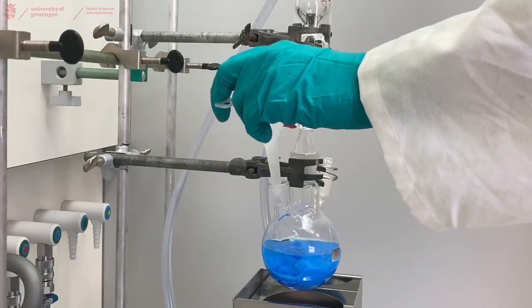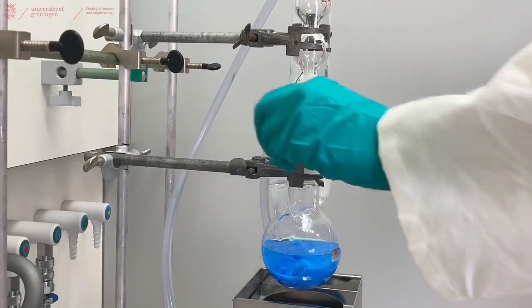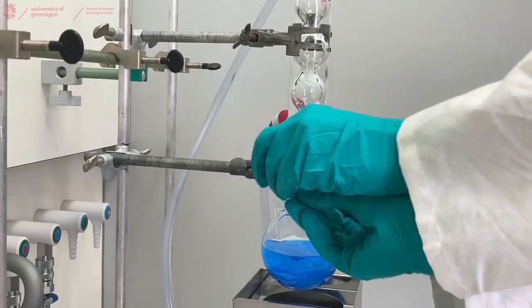When you're done adding your liquid, remove the funnel and place the stopper back into the three-neck flask.